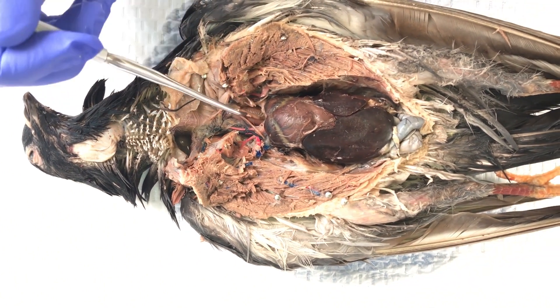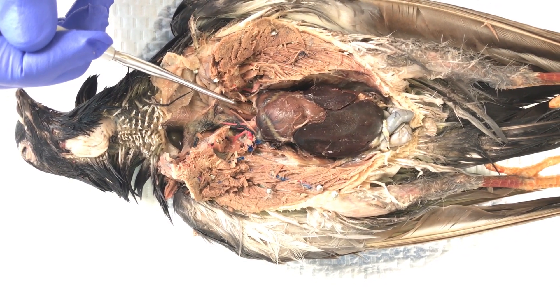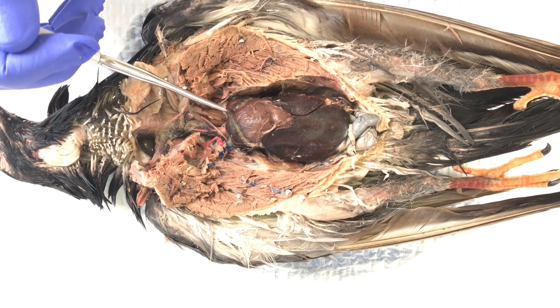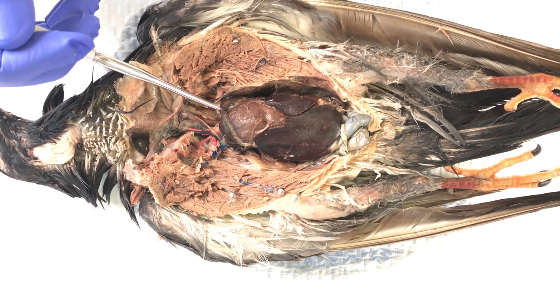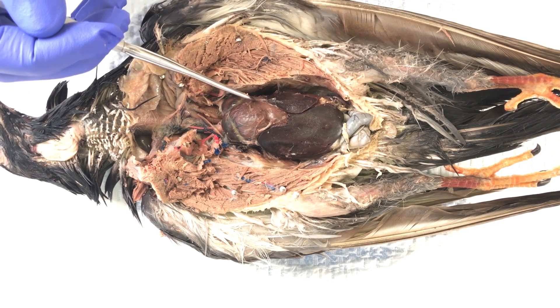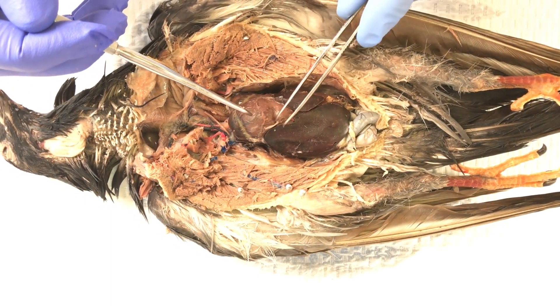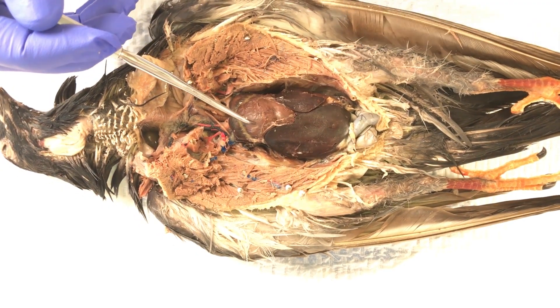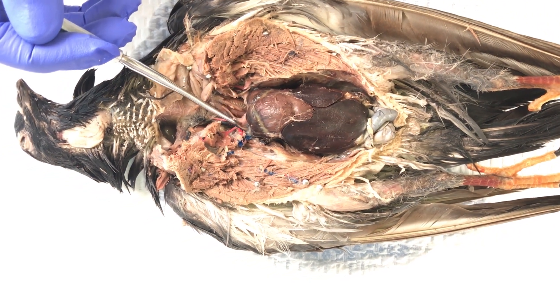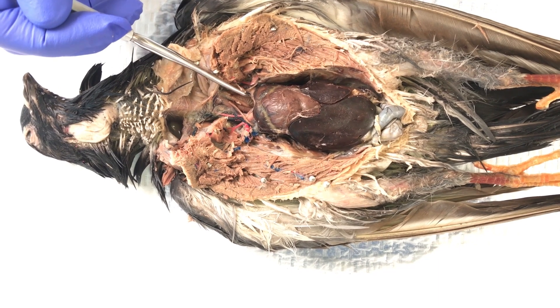You can see the trachea in the specimen that connects to the lungs. The right atrium, the left atrium, and the ventricles of the heart are visible. The pericardium is also present and slightly visible. We also have the brachiocephalic arteries of the heart.